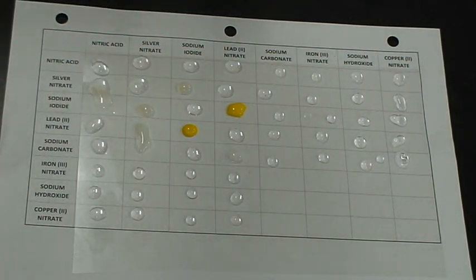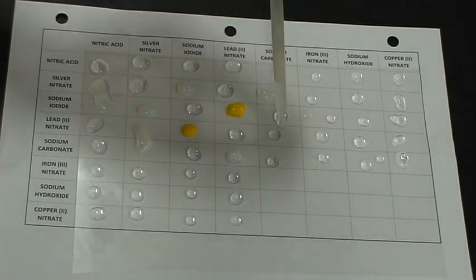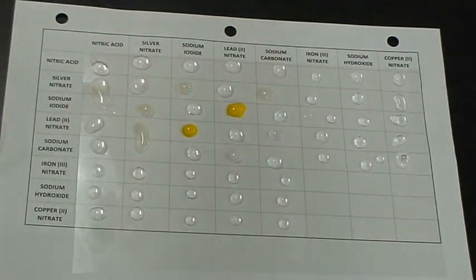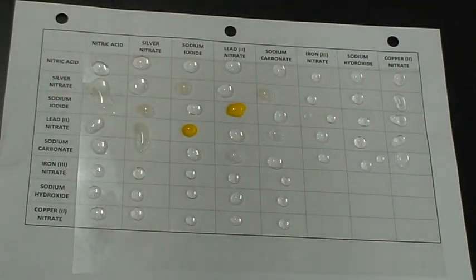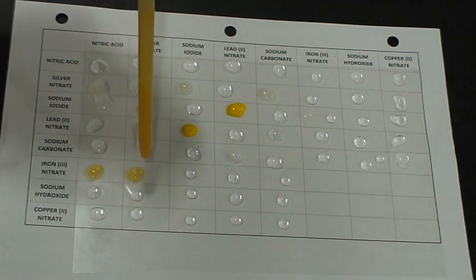Now you notice a couple of times that they actually mixed with each other. I'm not overly concerned about that. Certainly I could retest if I needed to. But you'll notice, and this might have been an observation some of you had as you're watching this, that as I add across, I also am adding it down. So they're going to be mixed twice overall. So just take a look at your results and match them that way.